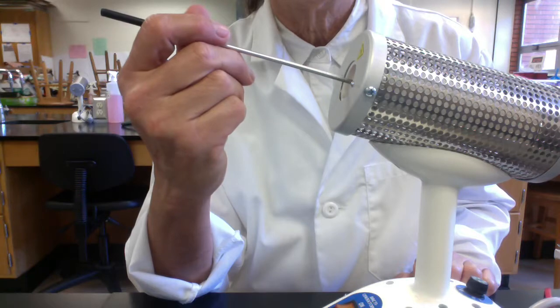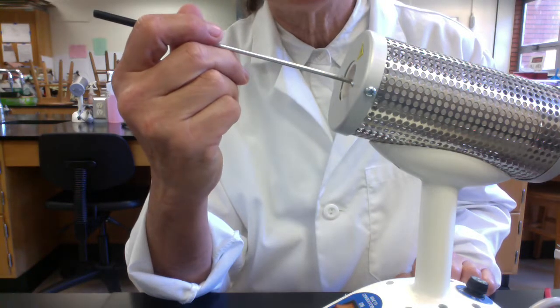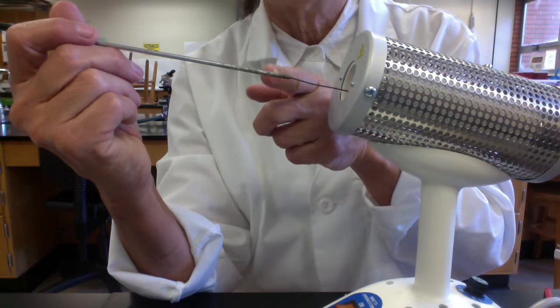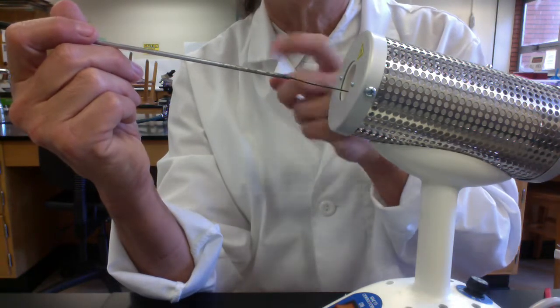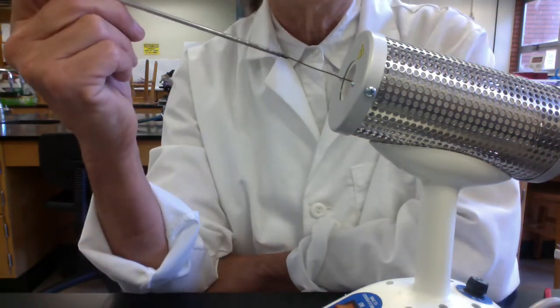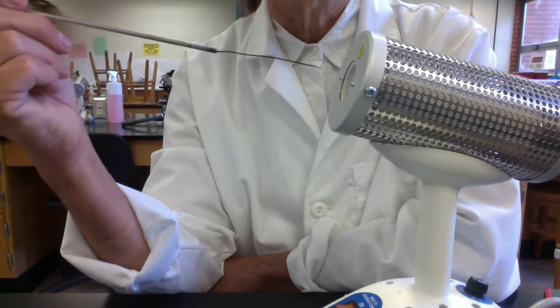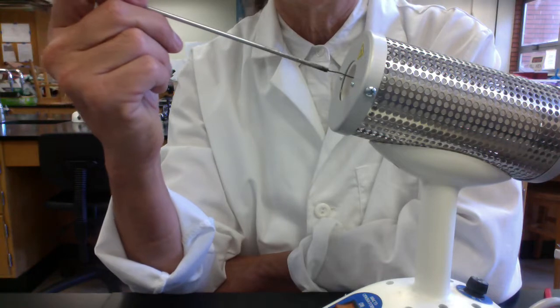We've discovered that the handle will get so hot it will actually cause a break, metal fatigue, where the handle meets the wire here. So what we've learned is when we're going to sterilize our loops is only to insert the wire portion.